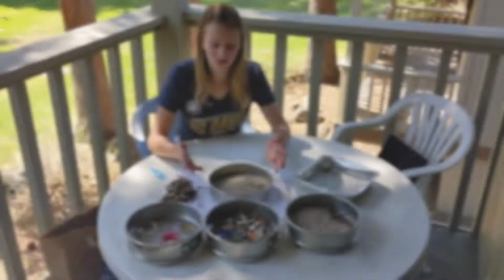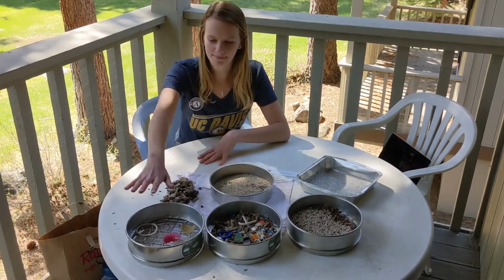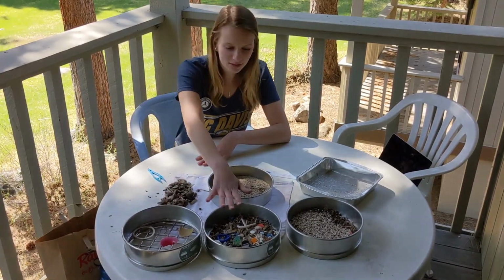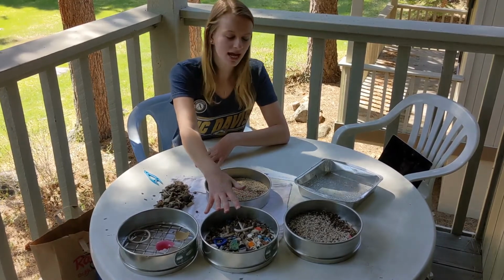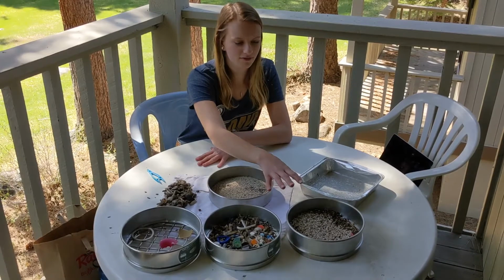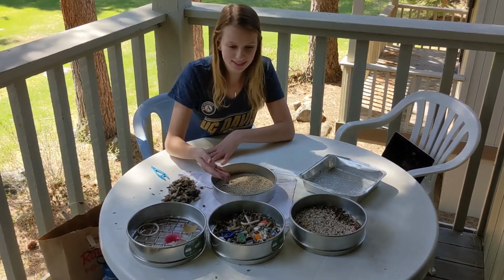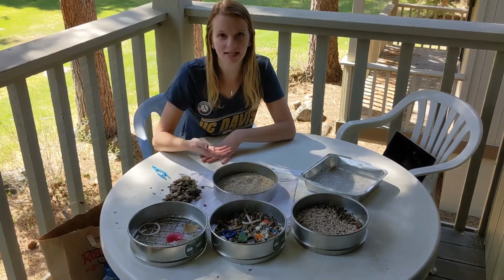You have sifted out all of these different pieces of plastic. You have it really easily laid out by macroplastics, those are bigger than 2.5 centimeters; mesoplastics, which are between 5 millimeters and 2.5 centimeters; and microplastics, which are smaller than 5 millimeters. And so we have microplastics and nanoplastics in these two. As you can see, it gets tougher and tougher to differentiate the plastics from the sand as you go.